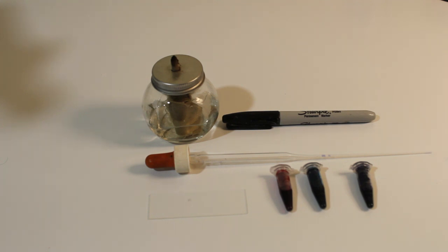For this video I'm going to assume that you know how to use your microscope and perform a serial dilution. If you're unfamiliar with serial dilutions please watch Episode 6 of Microbrews. If you need help with using your microscope please watch Episodes 1 to 5.